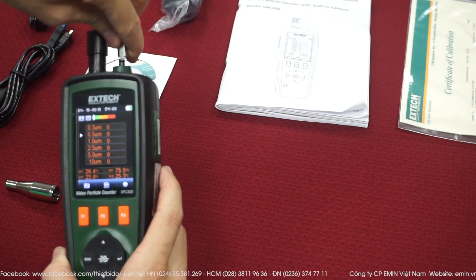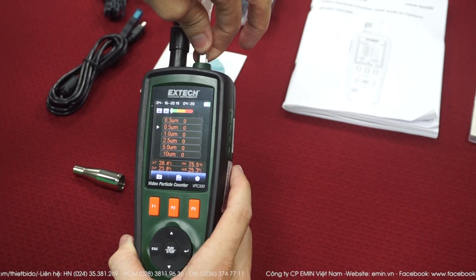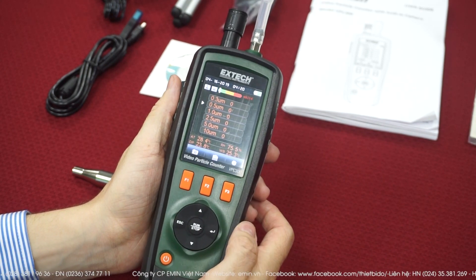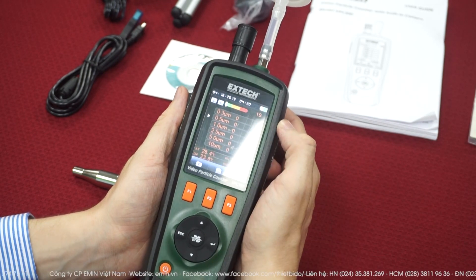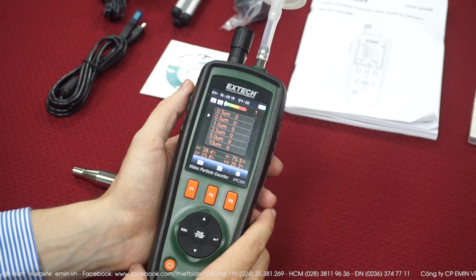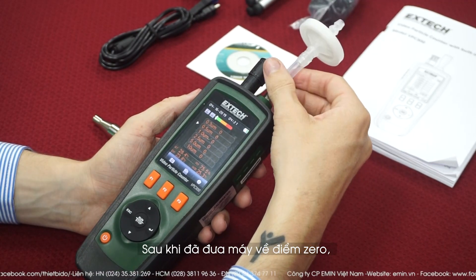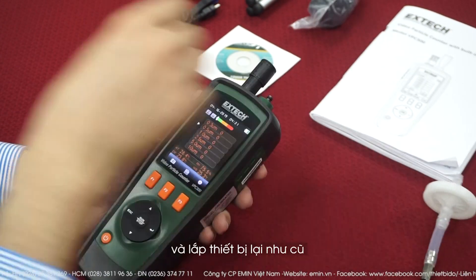You're going to plug the zero count filter back in. Now that it's done, you want to start at least one measurement, so you press run. You wait until the measurement is done. Now that the zero is set, you unscrew the filter and put the original inlet back in.